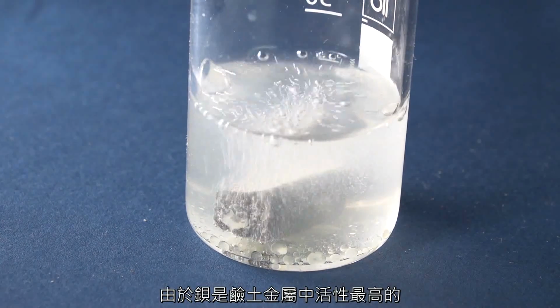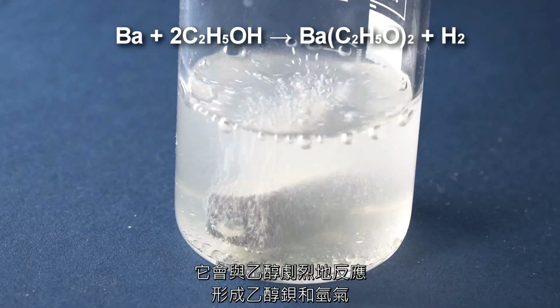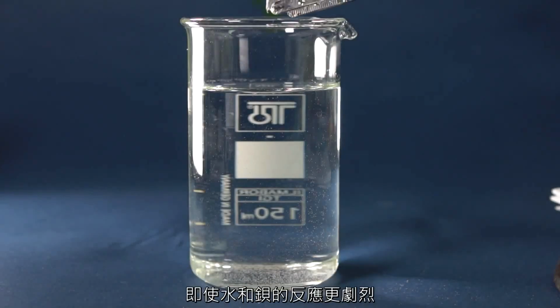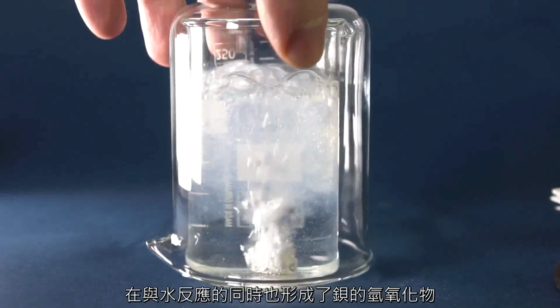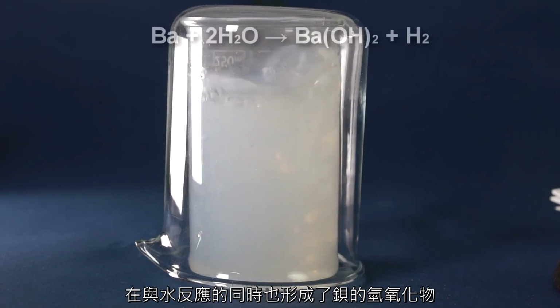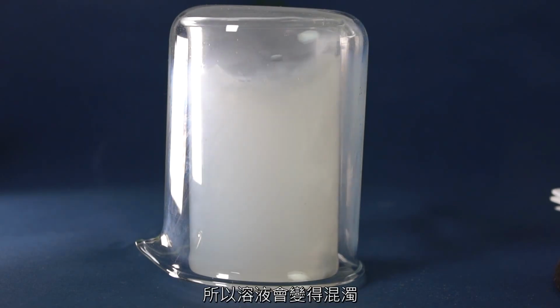Since barium is the most active of the alkaline earth metals, it reacts very actively with ethyl alcohol, forming ethoxide of barium and hydrogen. With water, barium reacts even more vigorously, releasing large quantities of hydrogen, and also forming barium hydroxide during this reaction with water. This compound is only slightly soluble in water, and hence the solution becomes turbid.